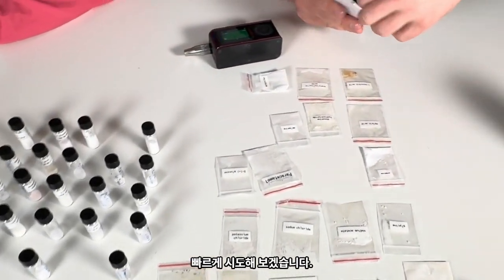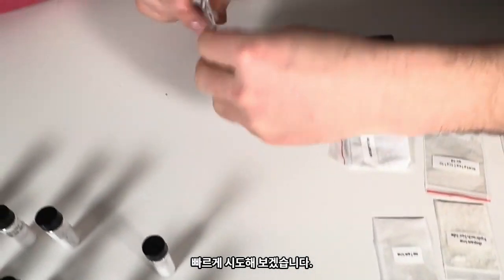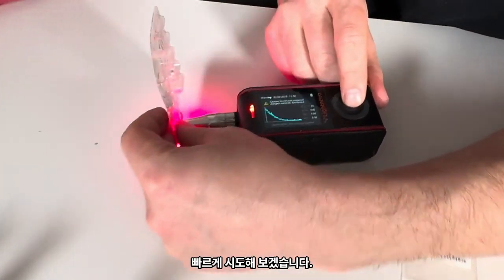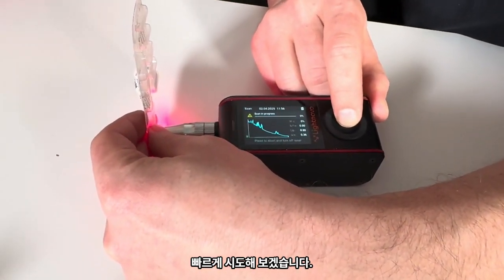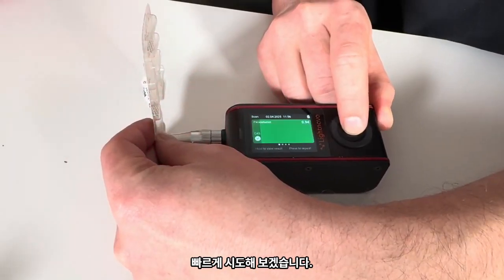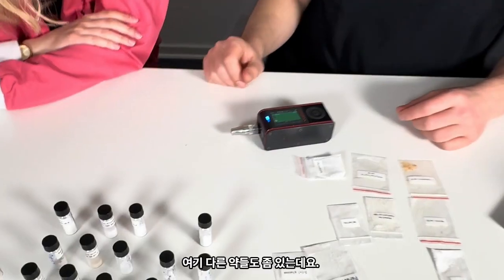Another paracetamol, you know, another packaging we have. Quickly, let's try that. Paracetamol 94%. Oh, that was fast.